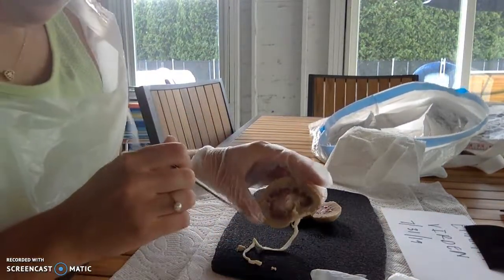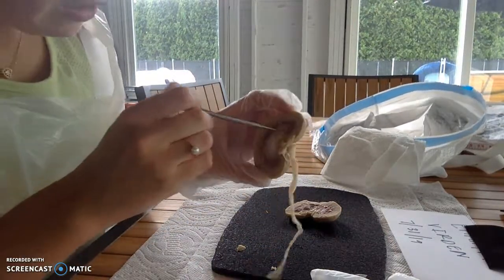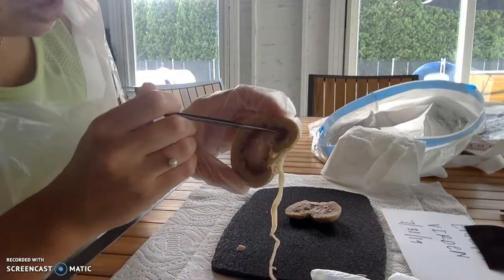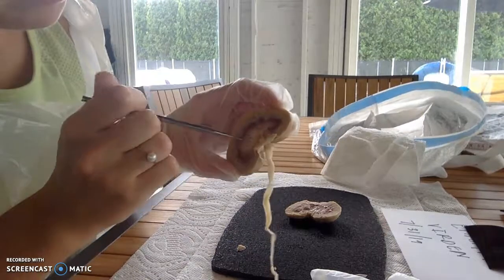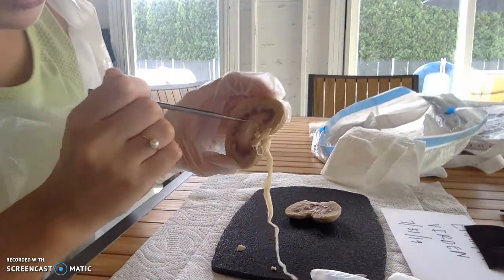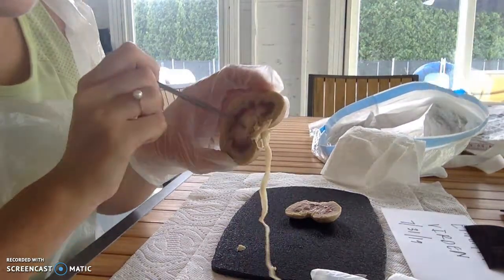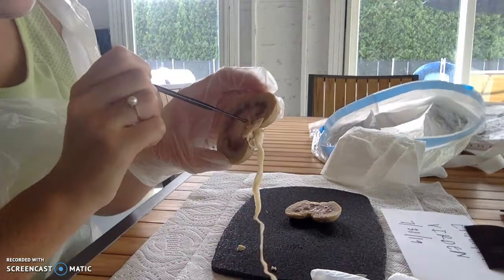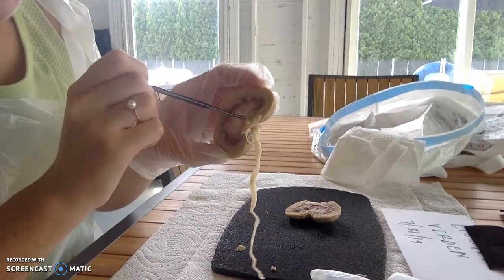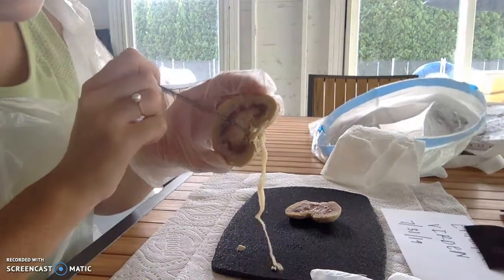And then you have the minor calyces, which is the top part right here of the renal pelvis. Okay, and this is the renal pelvis. The minor calyces is here. The major calyces is closer to the ureter here. And then, like I mentioned before, this is the renal pelvis.